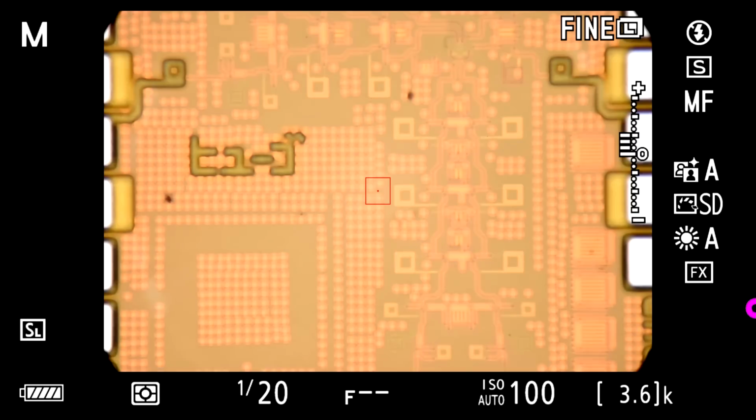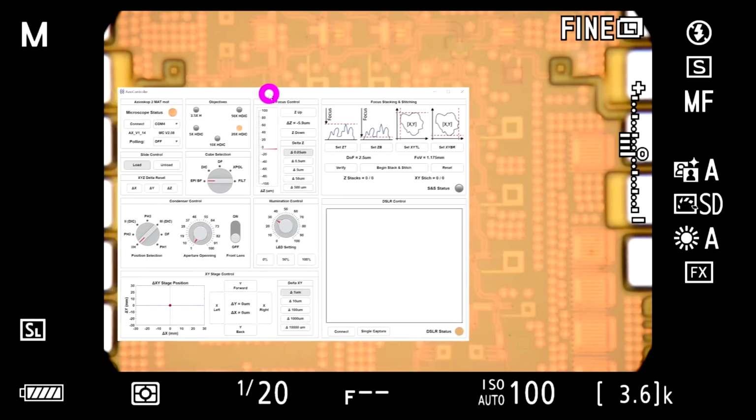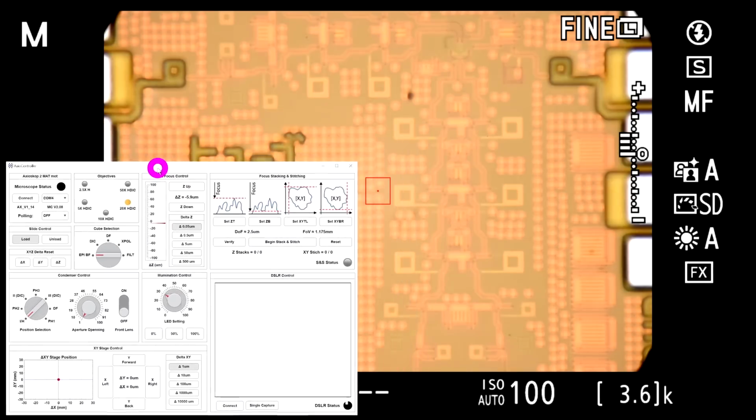So using this now, if I go back into the software, I can connect to the camera. Let me turn the polling off. No need to do that. Connect to the camera. And there it is. These, by the way, should be green, but because I'm using a chroma filter, it's basically looking through. If I move this around, you can see that they're basically transparent in the way this is set up.